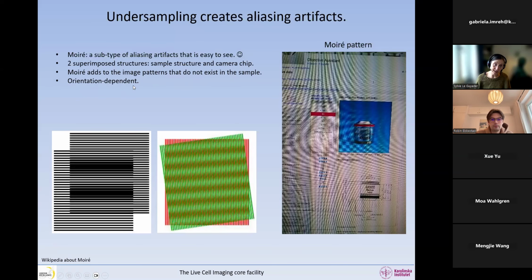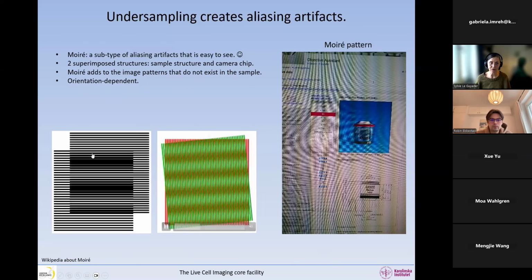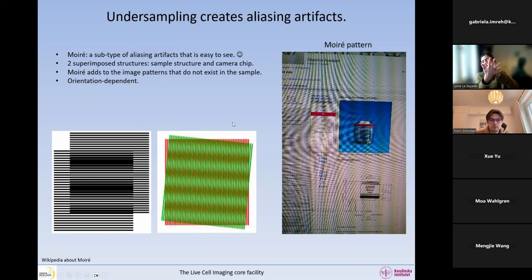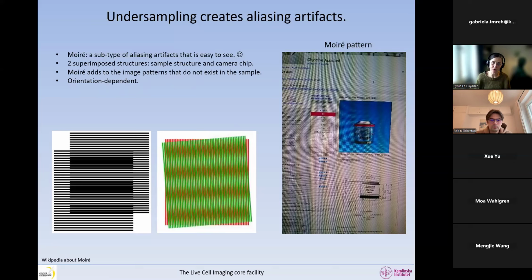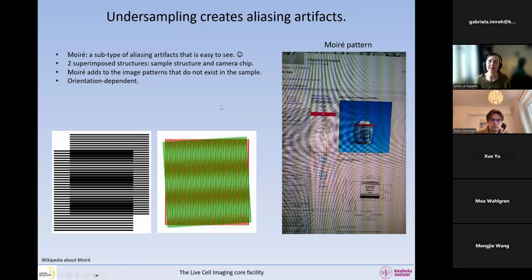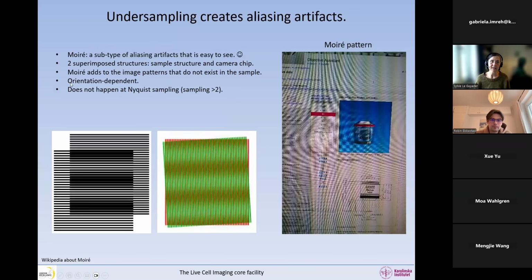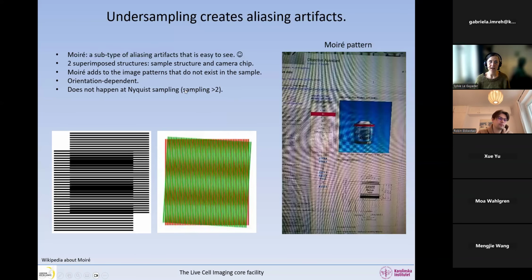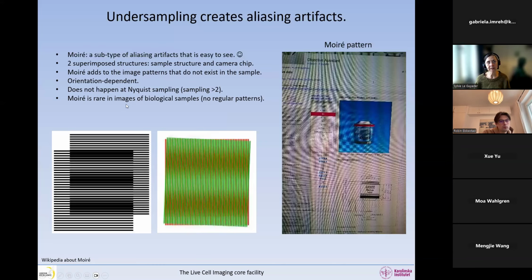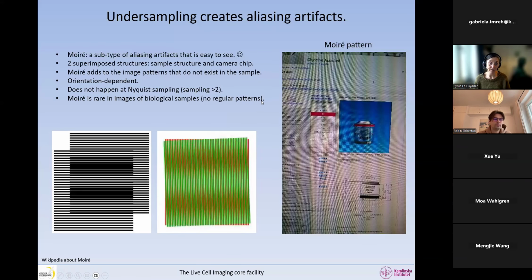And this is orientation dependent. This is the reason in here we have all these wavy lines instead of having straight, thick lines like this. It depends on the relative orientation of the two structures. So if one structure is not completely flat, like a screen is a bit not completely flat, then you can see that it changes with the orientation. This does not happen if we image at Nyquist sampling, so when the sampling is more than 2. Moire is very rare in images of biological samples because we have no regular patterns in our samples, and that's the reason why we do not get moire.